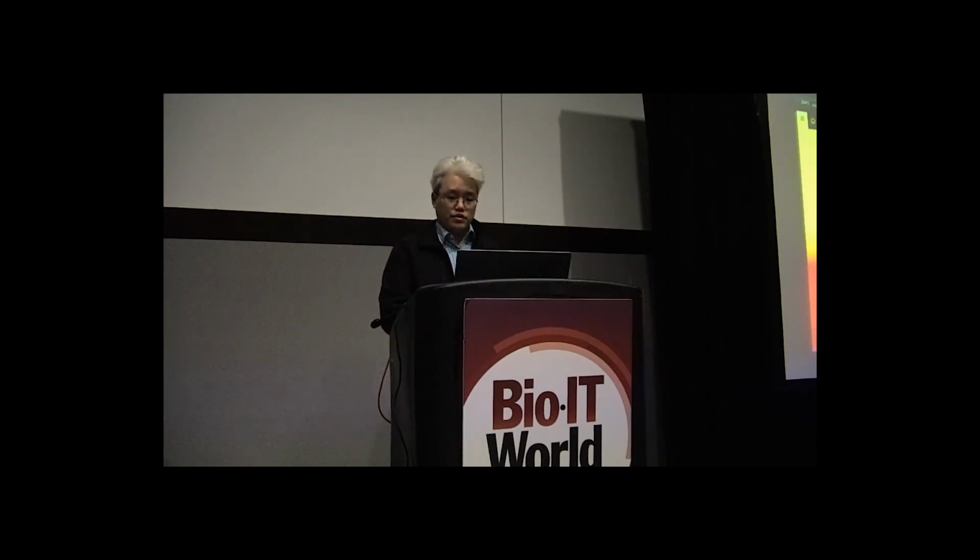So to figure that out, if you go up to the top here, you'll see North Virginia. If you don't, click the drop down underneath it and pick that. Okay. All right, so back where I was.